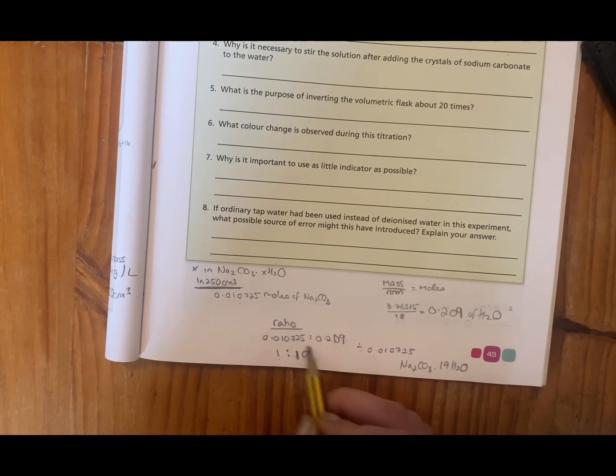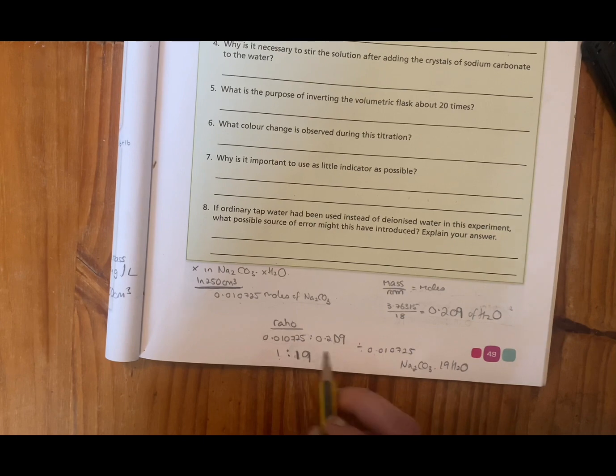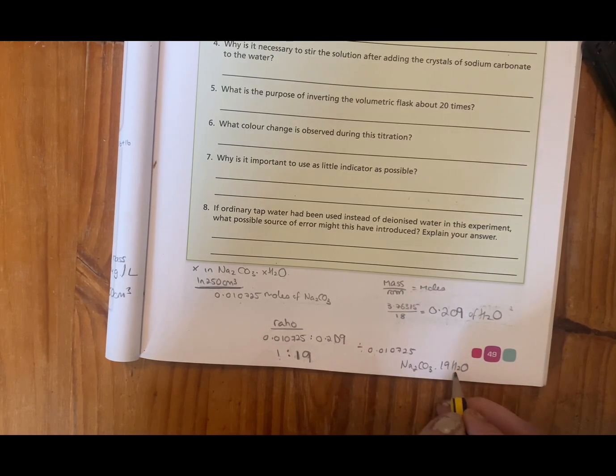Again, this is going to be different. In the exam questions, it's usually around 7 to 10, but it can go up to 15. That's just a general ballpark, so you know if you're kind of right. But this is what it ends up looking like for me.